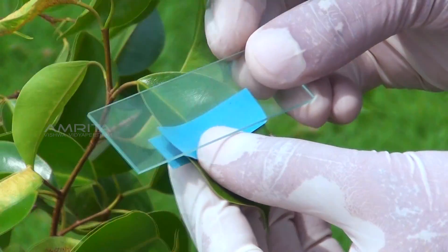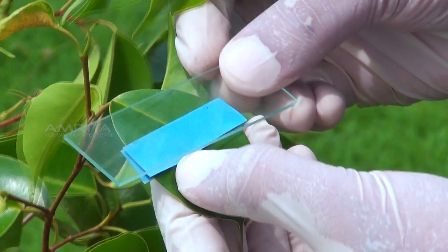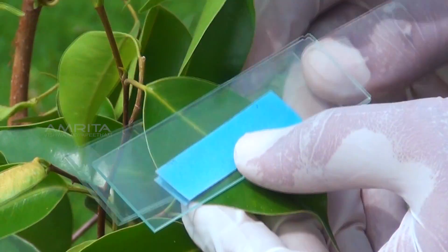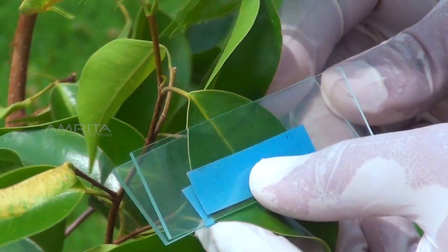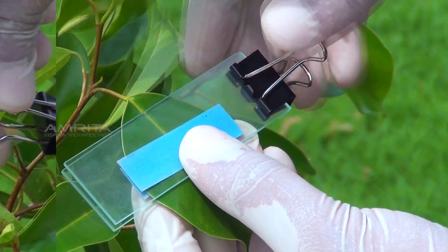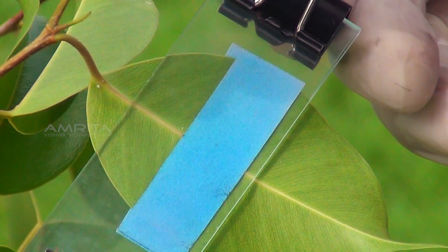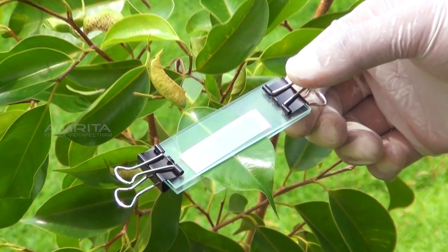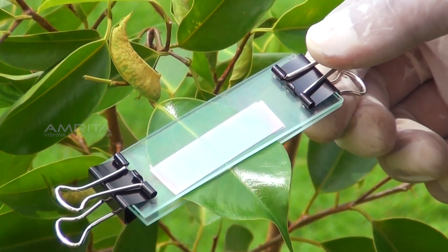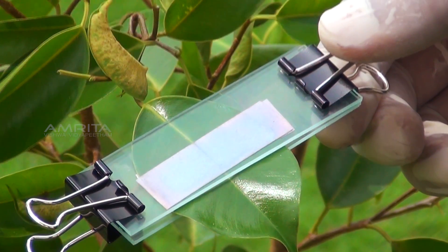Take two glass slides and place one over the upper and the other over the lower side of the leaf. Clip the slides together using binder clips. Note the time taken by the cobalt chloride paper to change its blue colour to pink.